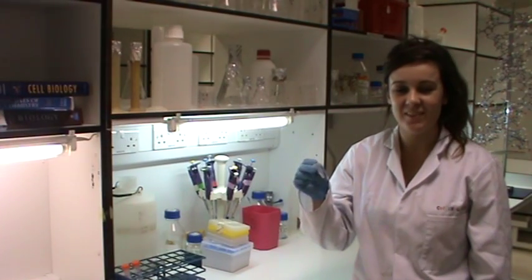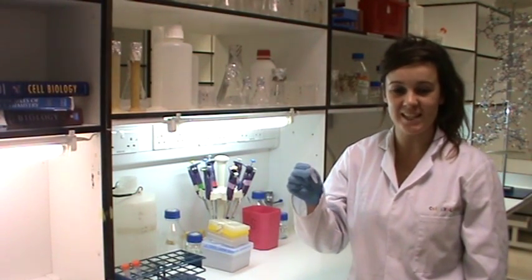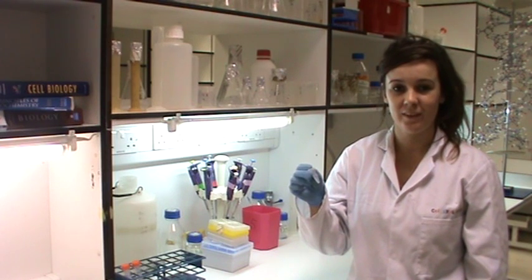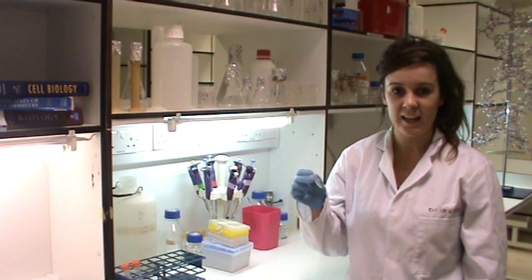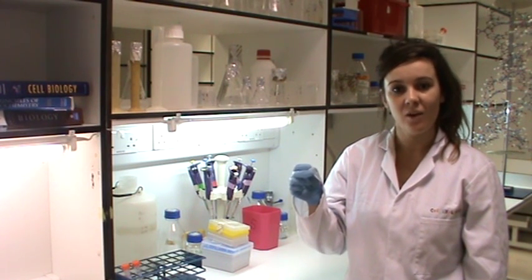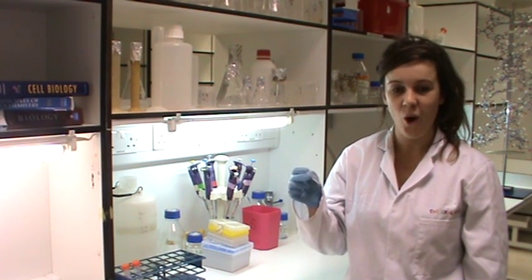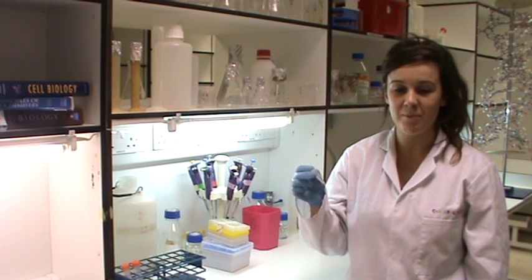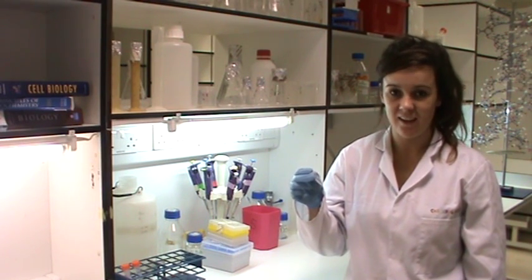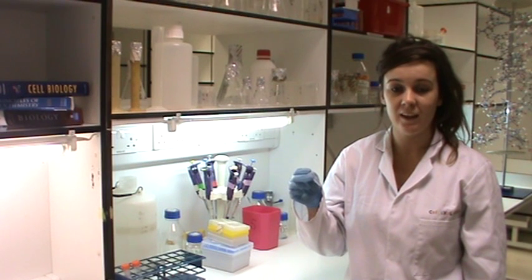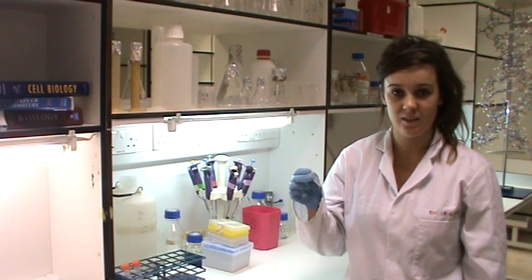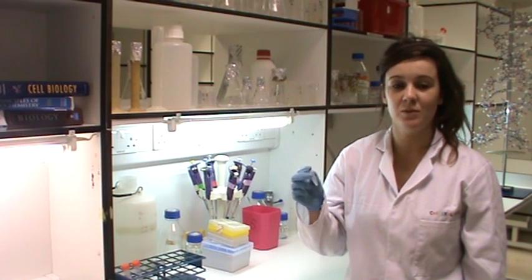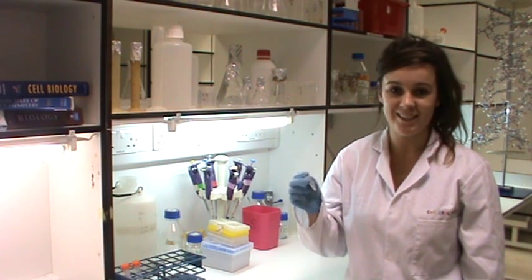I have now successfully extracted DNA from yeast cells here in the lab. This DNA can be stored at 4 degrees Celsius in the fridge. Now that we have extracted the DNA, what can we do with it? Well, there are lots of different applications of extracted DNA including DNA profiling, genetic engineering, and medical diagnosis. Let's go talk to someone who knows all about DNA extraction and its applications.